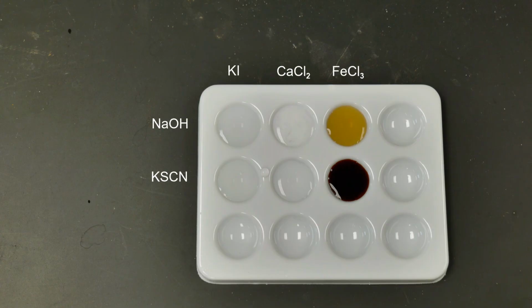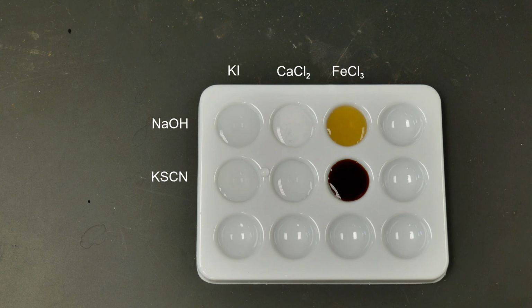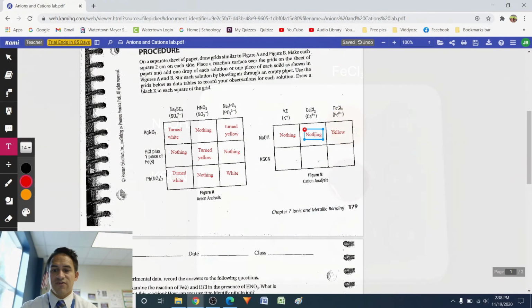So the sodium hydroxide, NaOH, was not able to identify the potassium ion. As for the middle one, I don't believe anything really happened either for that one, so nothing. And then for the iron 3 chloride, this one turned yellow. So it looks like the sodium hydroxide is good at identifying the iron 3 ion, but that was about it.